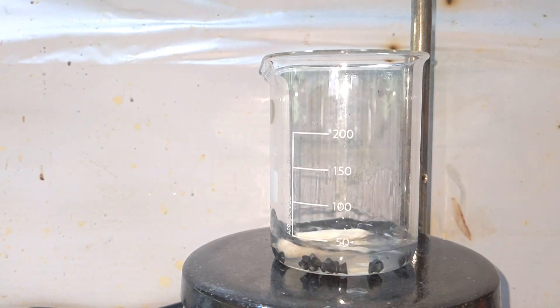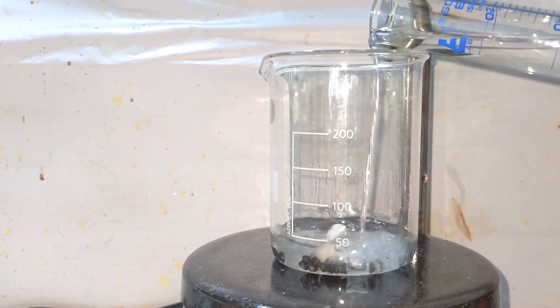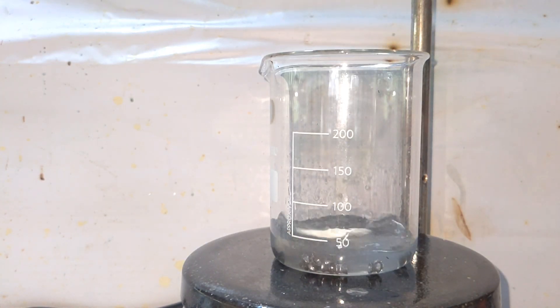So a few milliliters of hydrogen peroxide was added again. You can see how that black layer got removed and the clean shiny surface come into view.